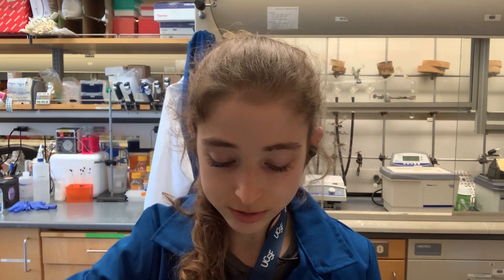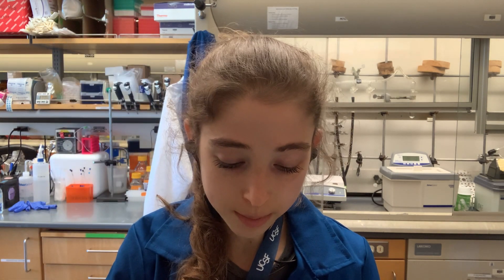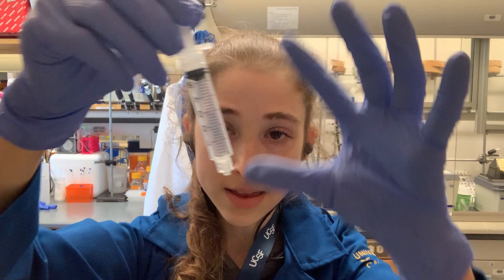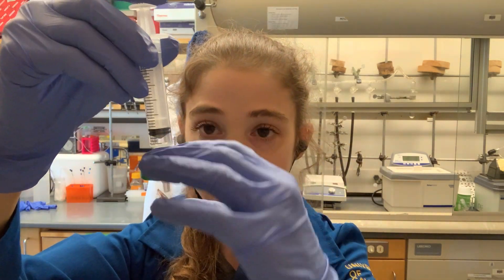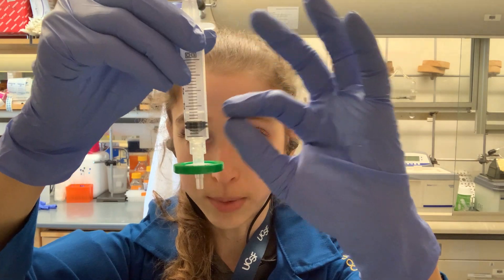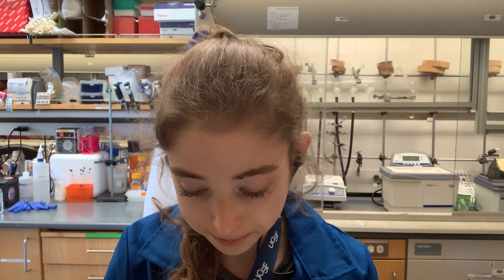If you're pulling liquid up directly into the syringe, especially for a smaller volume, pull a little bit of air up first before drawing up your sample. Then when you push out through the filter, that air above the sample will help push everything through the membrane, so you lose less sample.